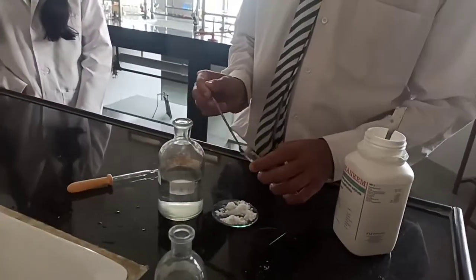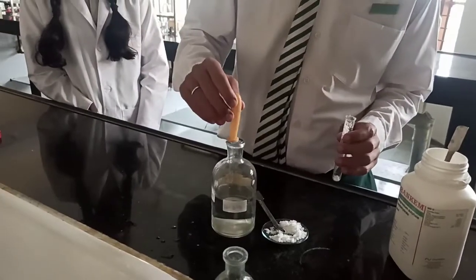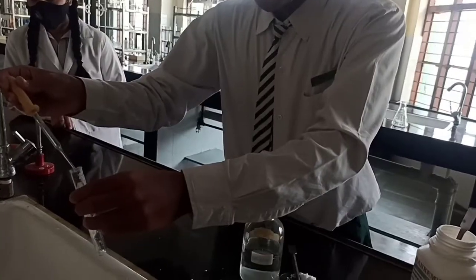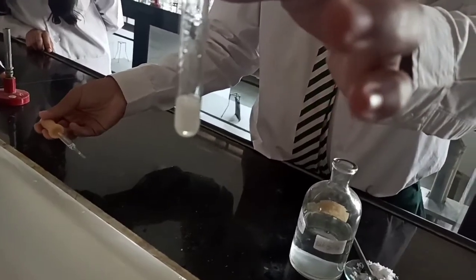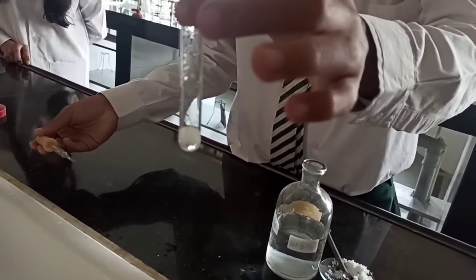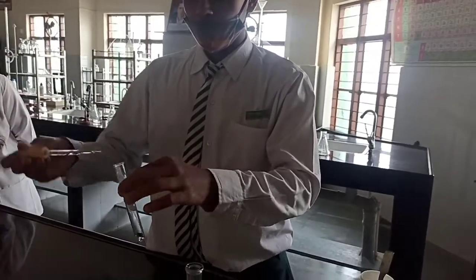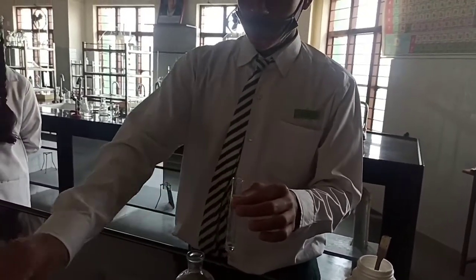So Mustafa, go ahead for the preliminary test. You will take a pinch of salt in the test tube. And now the first thing for anion detection is addition of dilute sulfuric acid. So can you see the evolution of brisk effervescence? So we can infer, we can get an idea with this that there may be the presence of carbonate ion. Carbonate ion is CO3 2 minus. So our preliminary test is done. Preliminary test was with dilute sulfuric acid. So we have got an idea it may be carbonate.